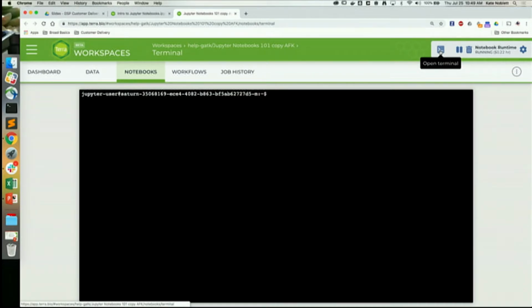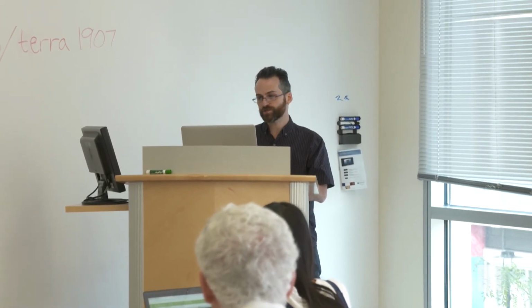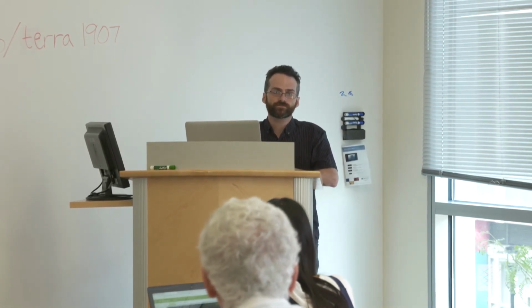I'm not familiar with Python, but it looked like you were importing things that were already installed. In R, you install something and then you import it, or library it. Can you install various packages you've written yourself on your machine? Yeah. Yep. Everything works the exact same way it would work in whatever R IDE you like to use. You just have to change the kernel to R. The next notebook we'll be running will be in R, so you can see how we install some stuff.